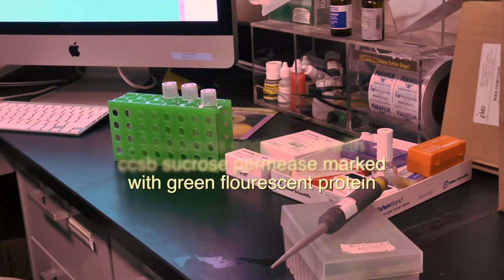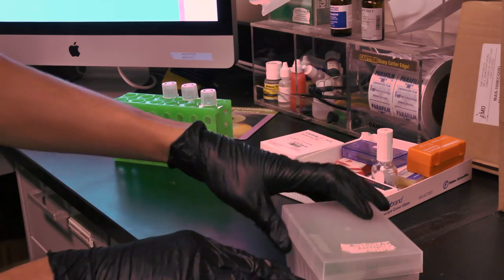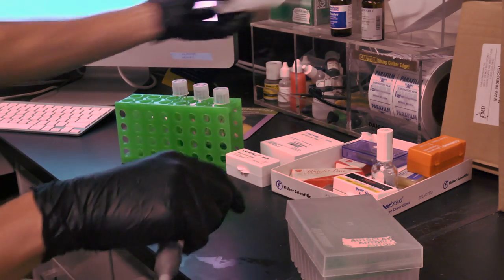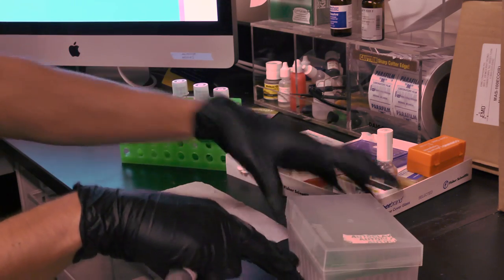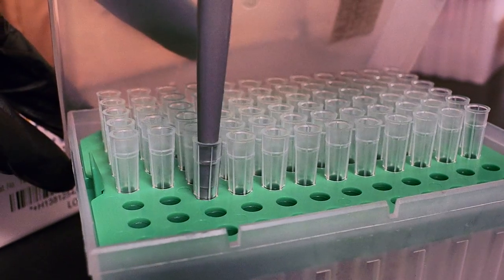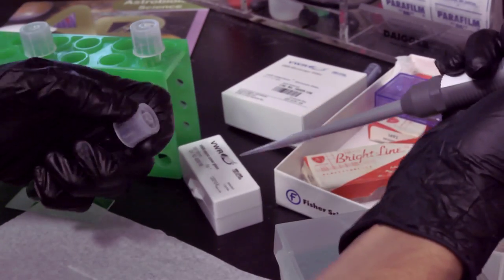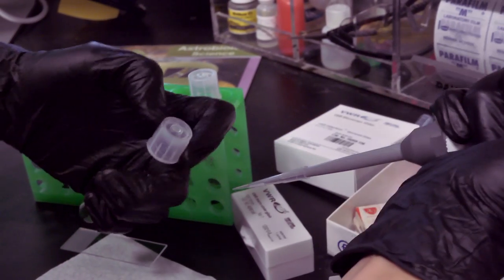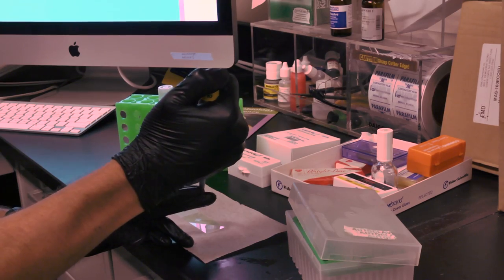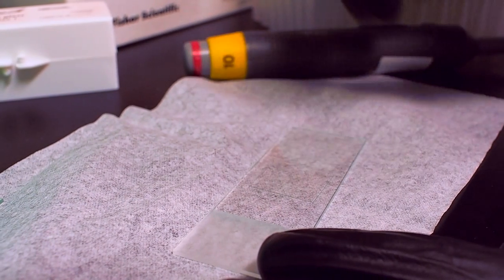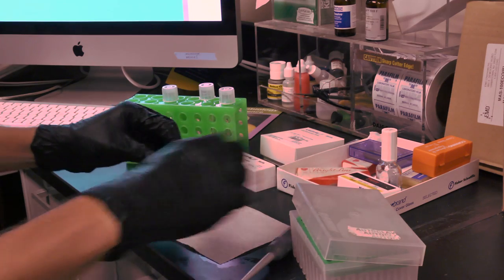Get the program ready and also prepare my slides. Check on my first sample. I've got three samples where I've attempted to mix all the cells together here. So I'm going to lay out a clean spot here and grab my slide. And then I will grab my pipette tip here and prepare the slide. Now this tube's a little long, so I'll probably just have to wipe down the pipette with ethanol to make sure I don't cross contaminate anything later. But this is an aliquot from the main culture that I've drawn in order to not contaminate it in this process. So I'm only drawing from a small sample here, since I'm clearly not using sterile technique, no flame or anything.